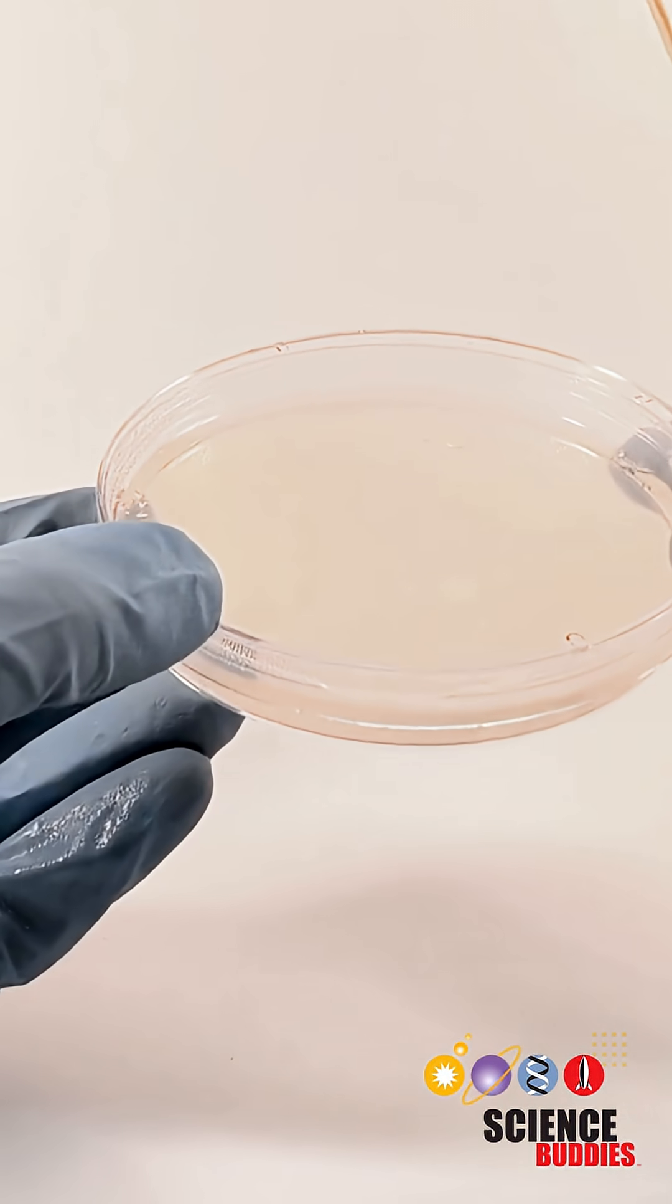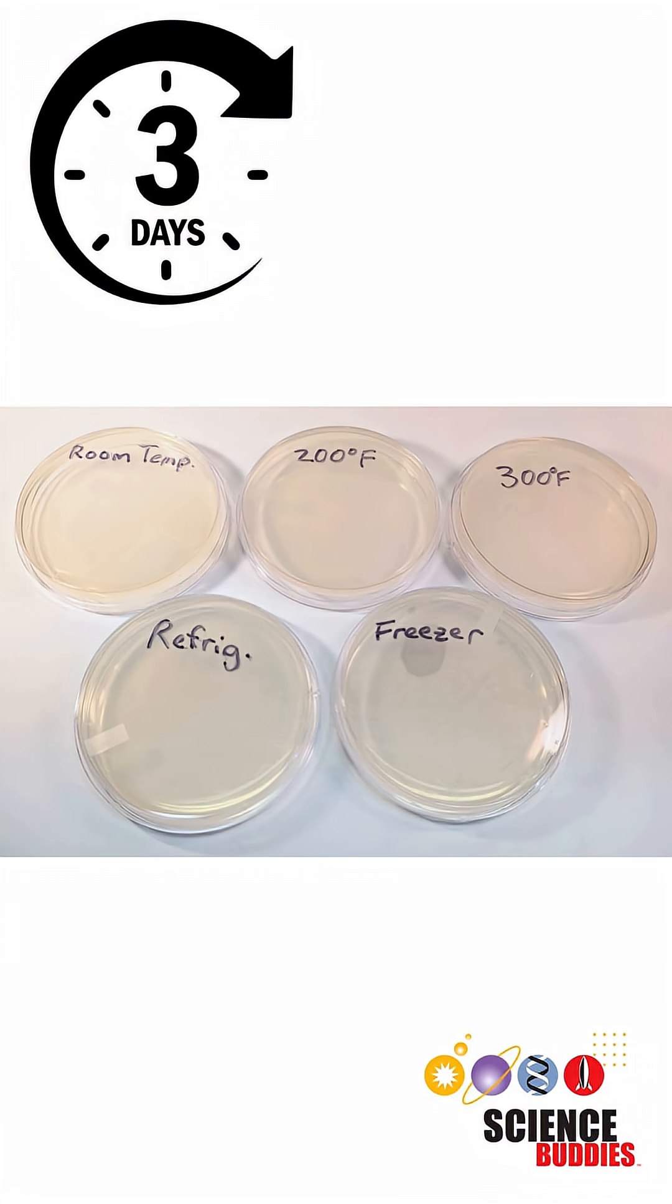Now it's ready to sit for a few days. After you are done preparing your five agar plates, go ahead and put them somewhere out of the way at room temperature upside down and check them each day for three days.